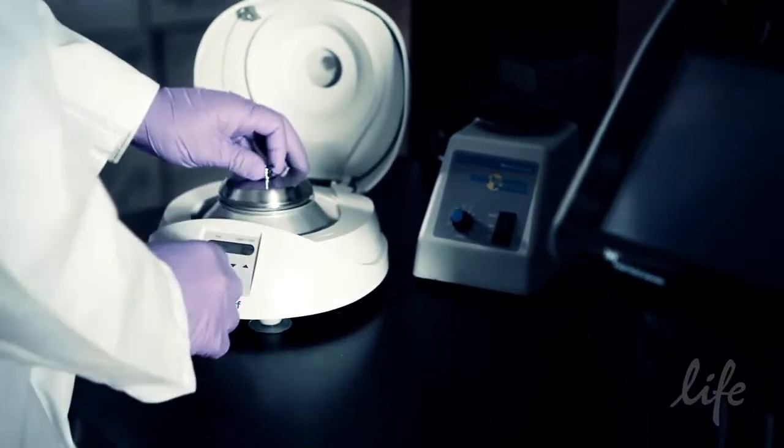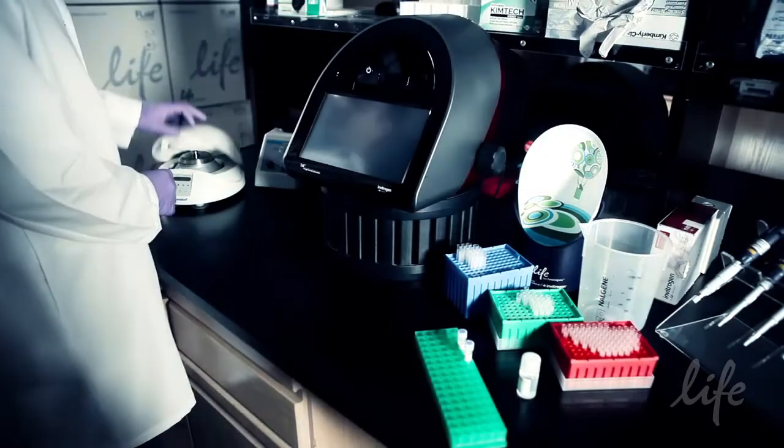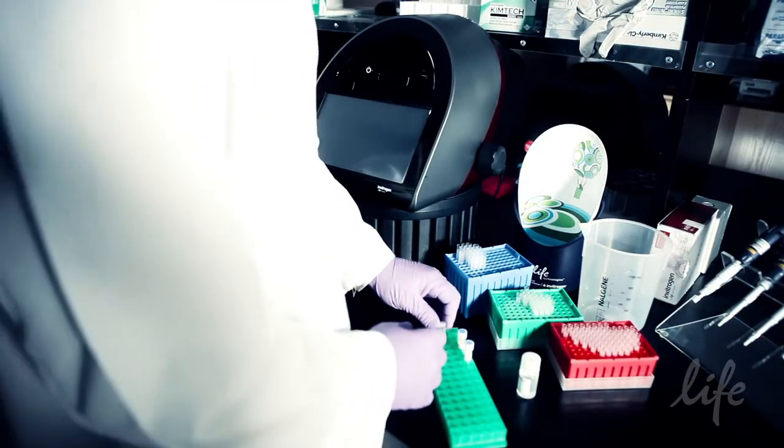Once the incubation is complete, centrifuge and resuspend the sample in 100 microliters of Annexin binding buffer.